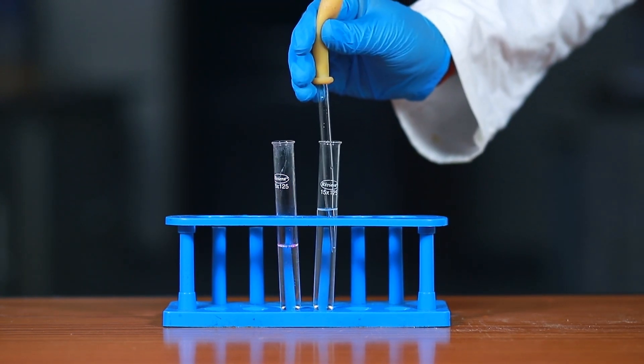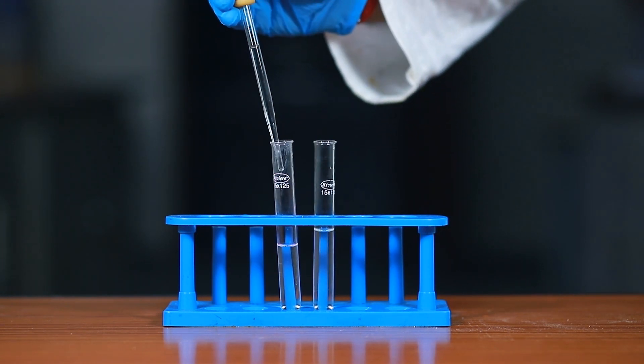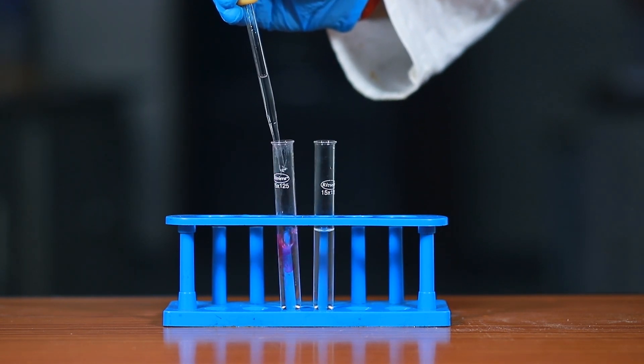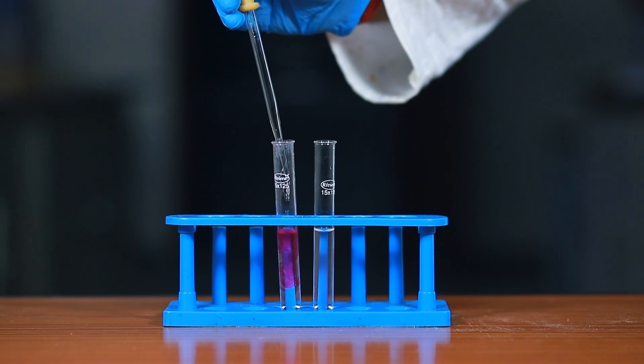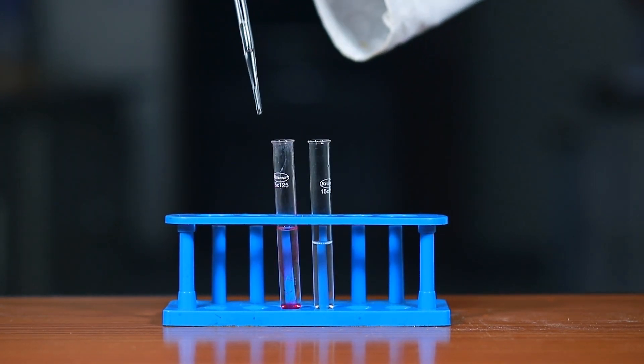What do we observe? On adding nearly 5 ml sodium hydroxide solution to the mixture of hydrochloric acid and phenolphthalein solution, the color of the mixture changes to pink.